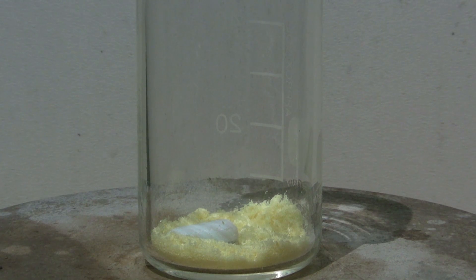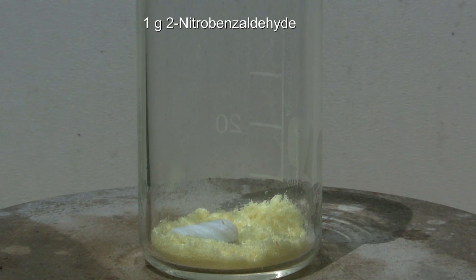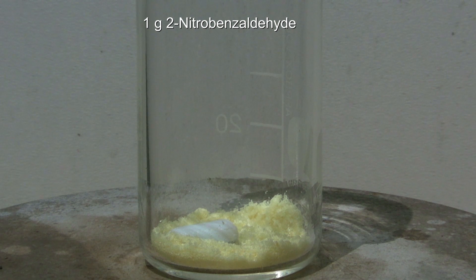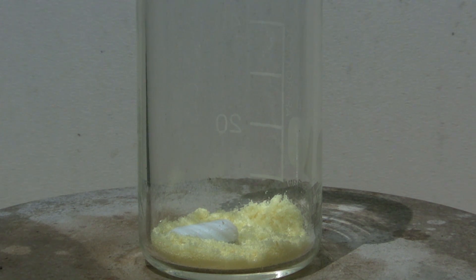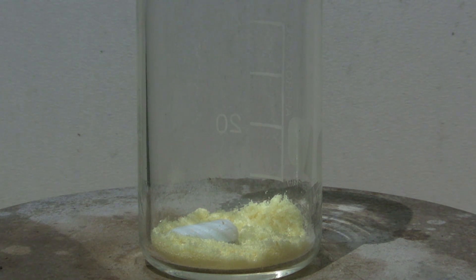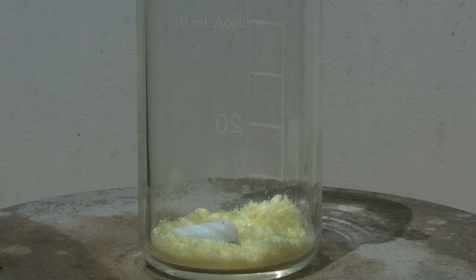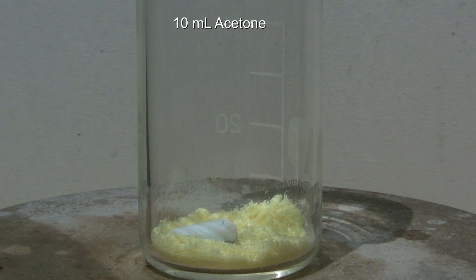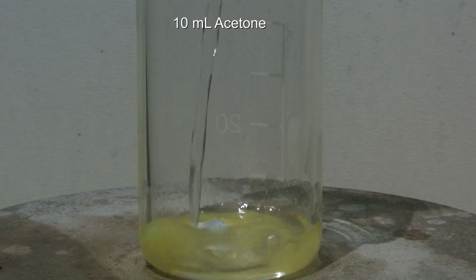First, 1g of 2-nitrobenzaldehyde and a stirring bar are added to a 50ml beaker that is placed on a stirring plate. Then 10ml of acetone are added and the mixture is stirred until everything has dissolved.